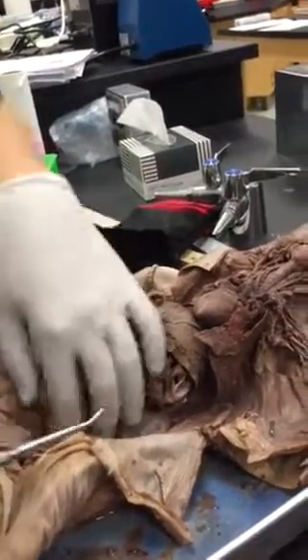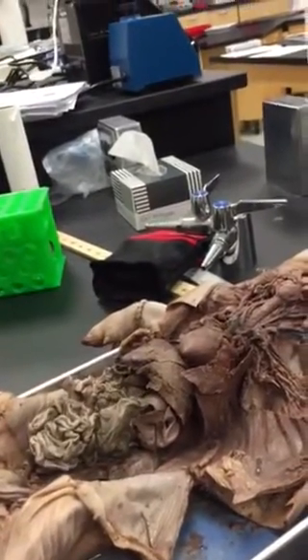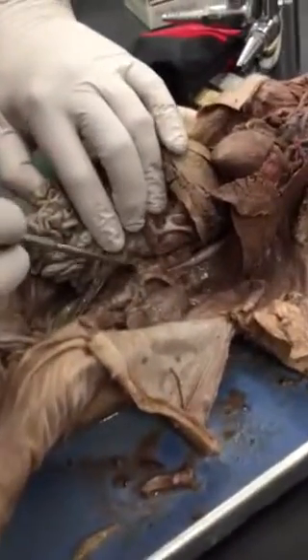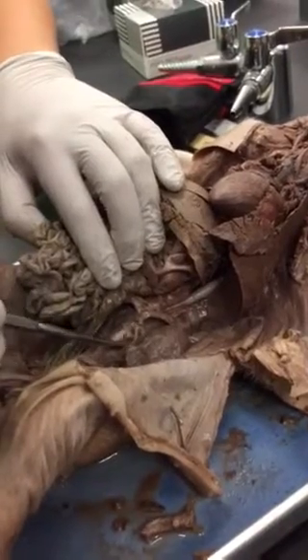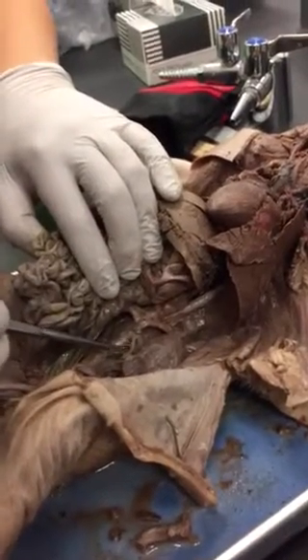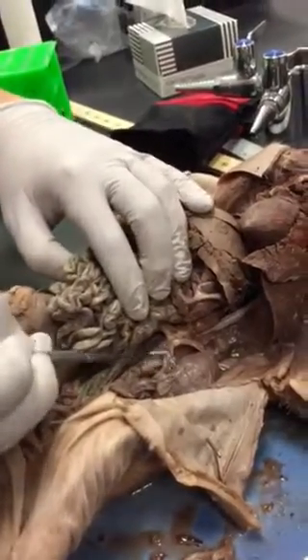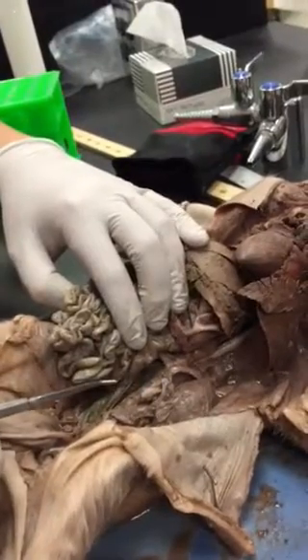Okay? All right, so then you follow down, you see those two bean-shaped structures on the sides. What are those? They're the kidneys, right? So right below this mesenteric, you can see here, there's your renal artery here. You guys see that? And you also see some blue things going across. What are those? Veins. What kind of veins?